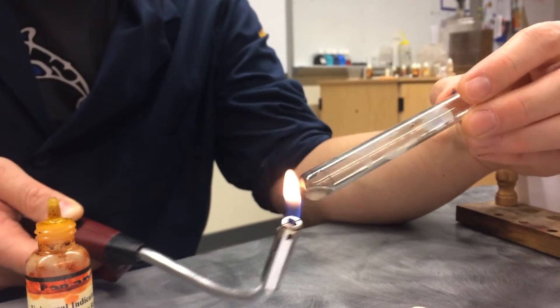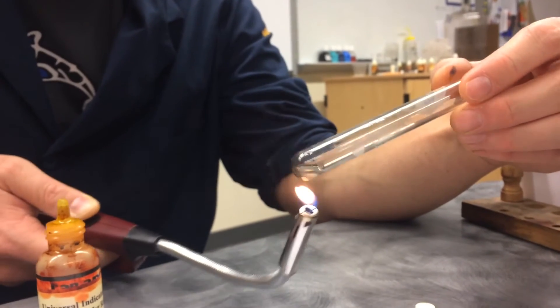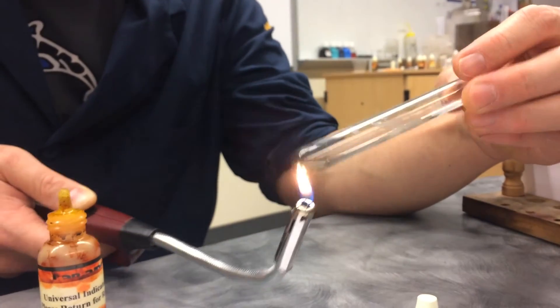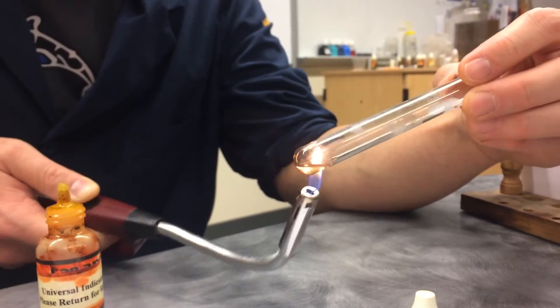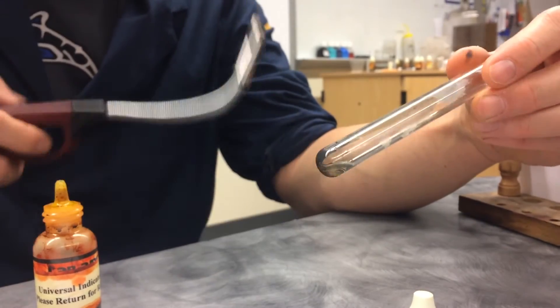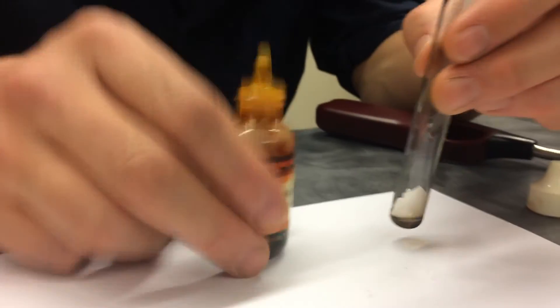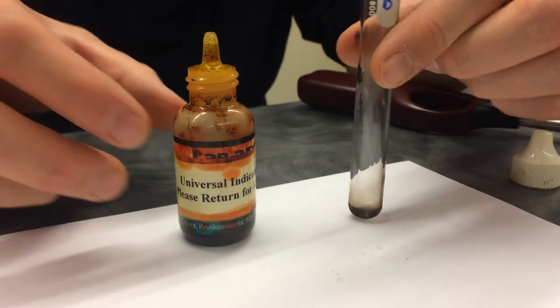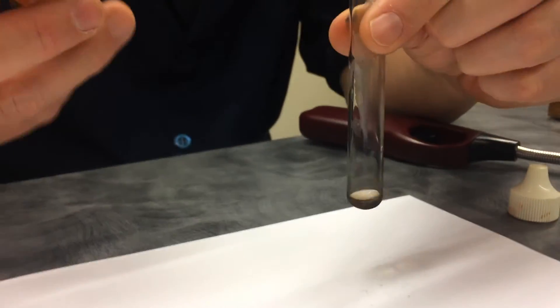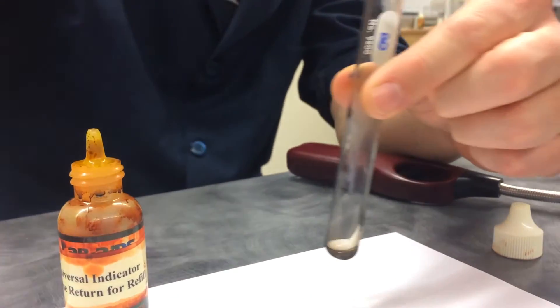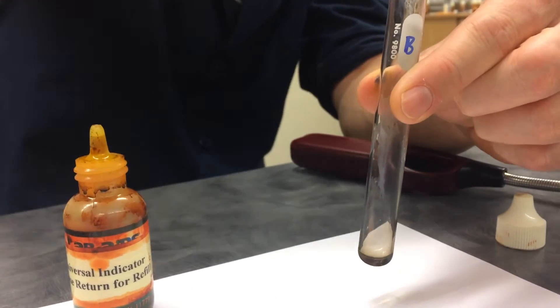So I'm trying to be very careful here, not to heat the glass in any one place, because otherwise it will break. And now I have my liquid. All right. Make your predictions. The blob. The blob. Is it going to be lard? Or is it going to be soap?